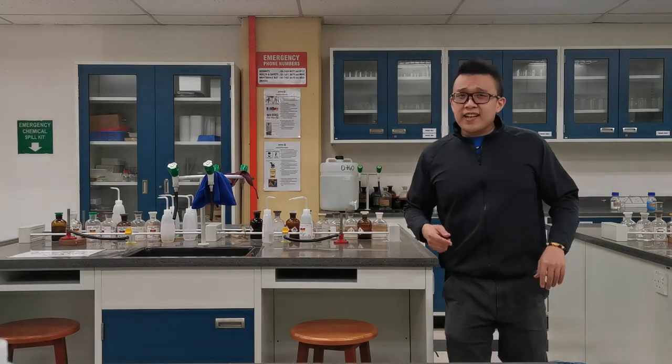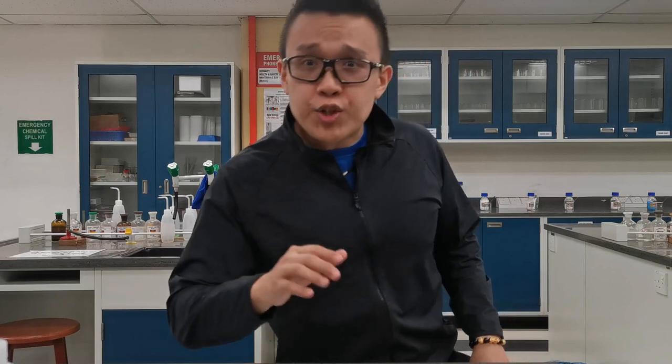The irrigation technique is not just to introduce the stain to the cells — it also helps to produce a neat and clean preparation of the stained tissue under the microscope. Now let's look into the proper techniques of how you can focus and view specimens under your microscope. Pay attention!